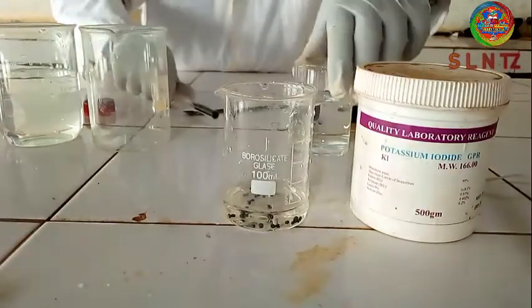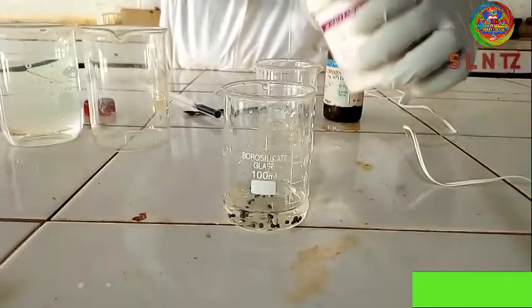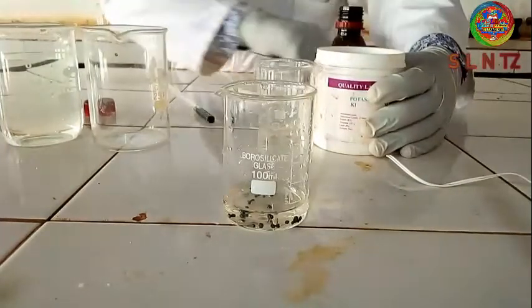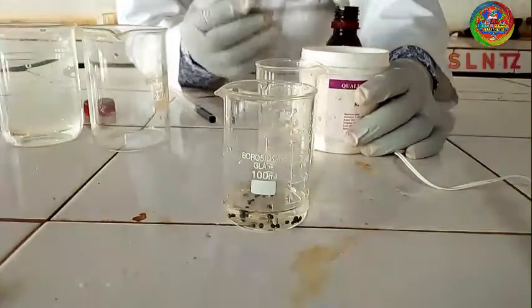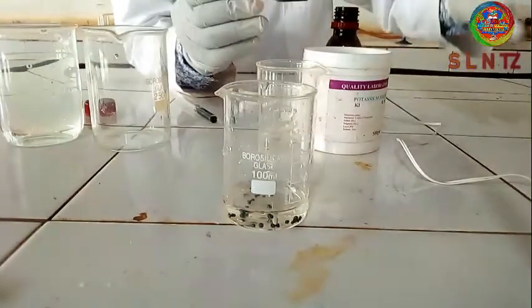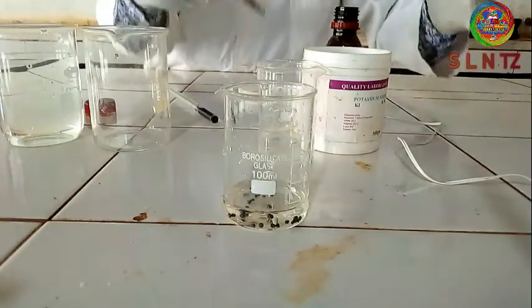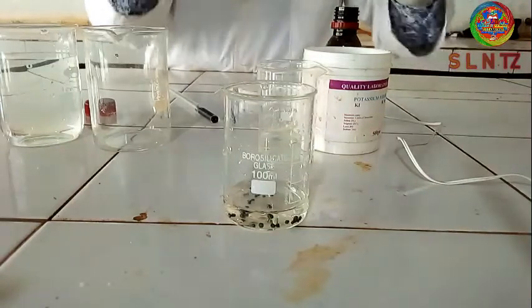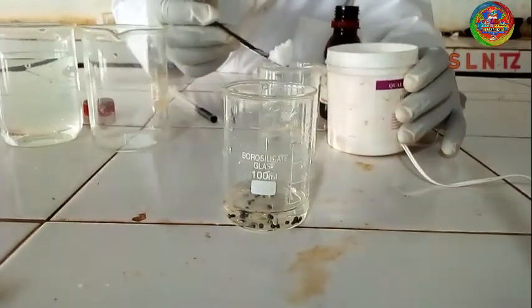You have to dissolve potassium iodide crystals first. I will take some potassium iodide. You can dissolve some amount of crystals — today I will not talk about concentration or the amount needed to make a certain concentration. Today I'm only talking about how to dissolve iodine crystals to make iodine solution. The issue of concentration I will cover in another lesson about preparing a standard solution of iodine. So first, dissolve a little amount of potassium iodide.